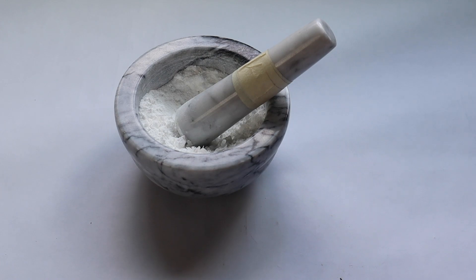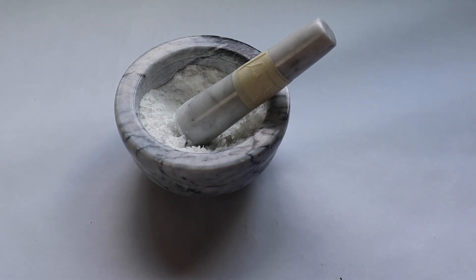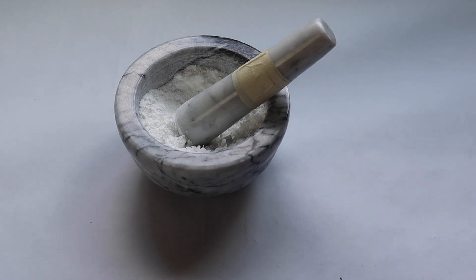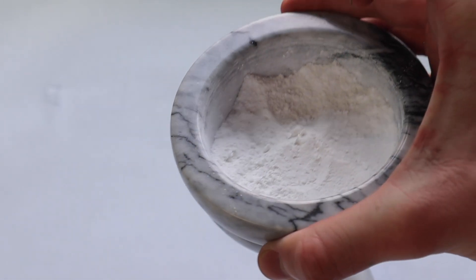It's about 95 degrees in here right now and I've been crushing aspirin tablets for about 10 to 15 minutes. It's a little bit harder than I expected but I'm almost done. This should be powderized enough for my purposes.